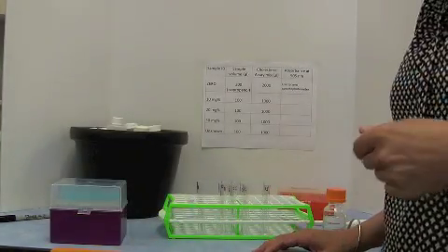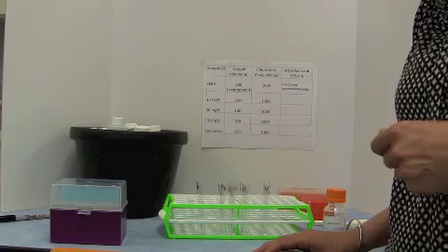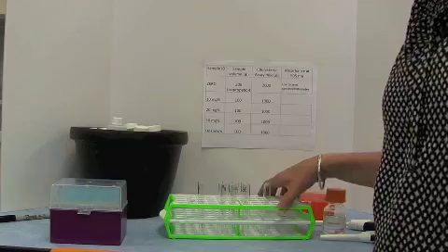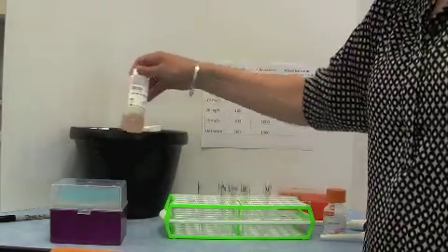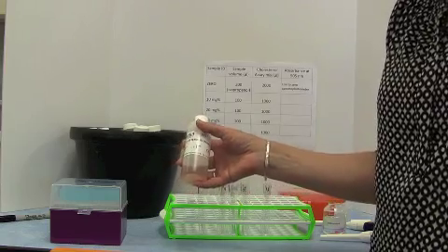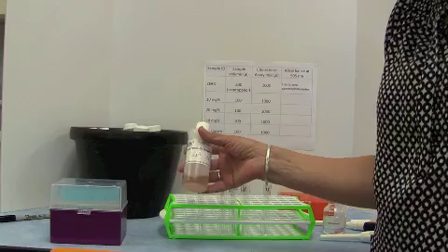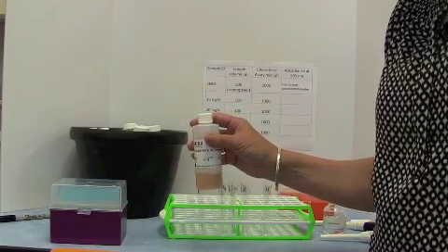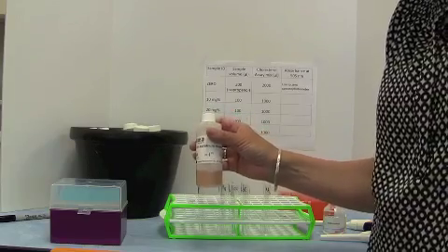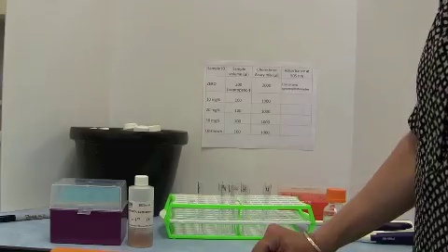So now you know how to pipette, you're ready to do your experiment. For our experiment, we're going to be mixing together our cholesterol assay mixture. This assay mixture contains all of the enzymes we need, so that if we add cholesterol to it, we'll get the purple colour, which we're then going to measure in the spectrophotometer. So there's our assay mix.